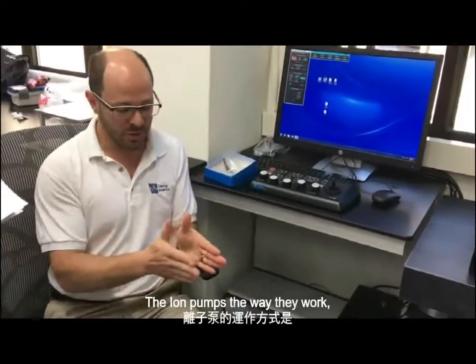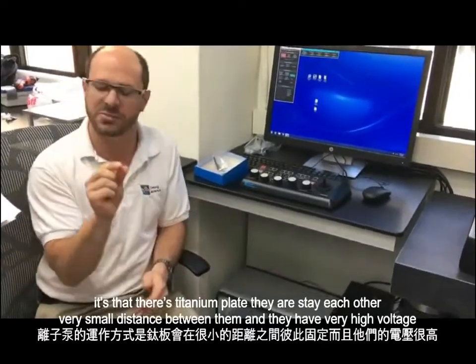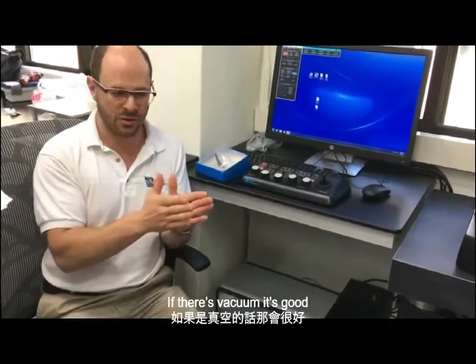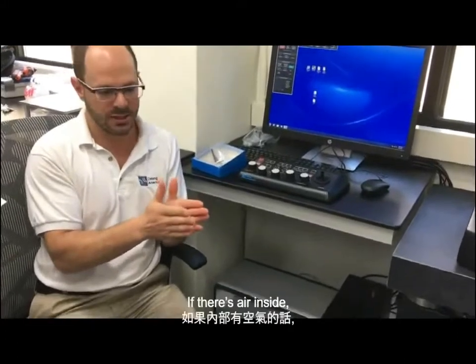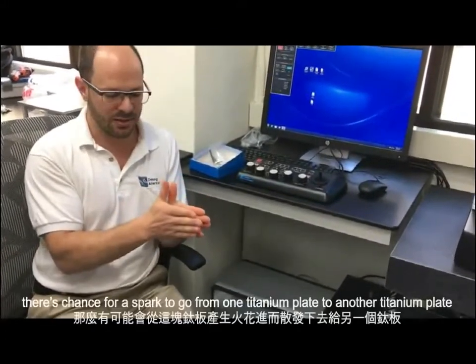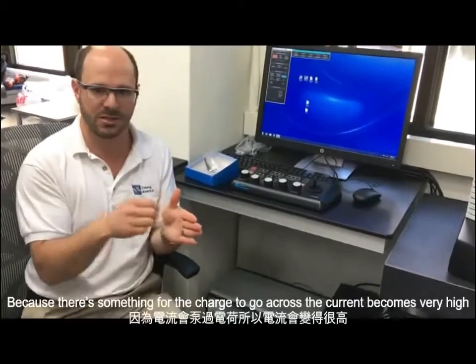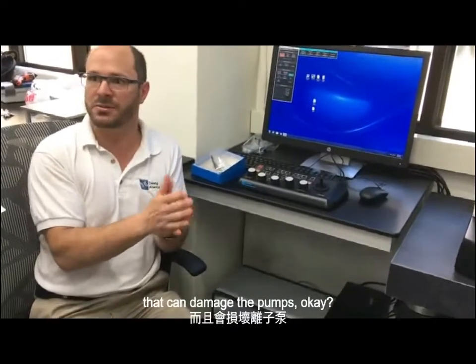The way the ion pumps work is that there are titanium plates all next to each other with a very small distance between them, and they have a very high voltage. If there's vacuum, it's good because there are no molecules between the titanium plates and there's very low current. If there's air inside, there's a chance for a spark to go from one titanium plate to another because there's something for the charge to go across, so the current becomes very high. That can damage the pumps, okay?